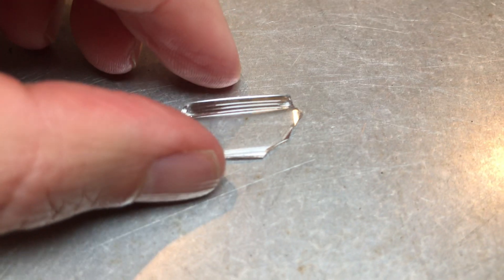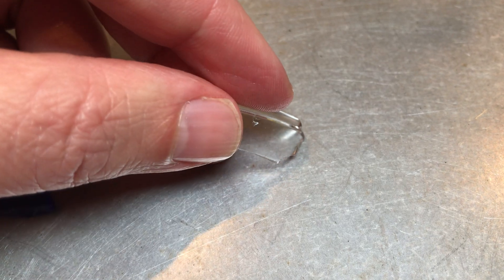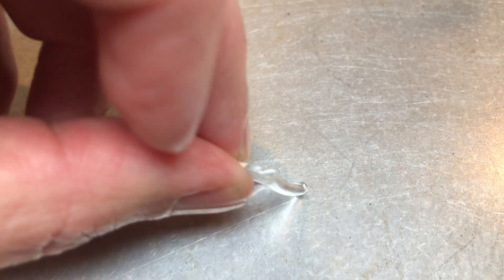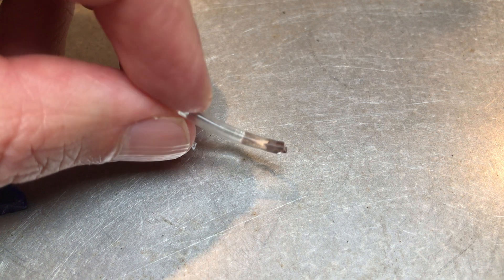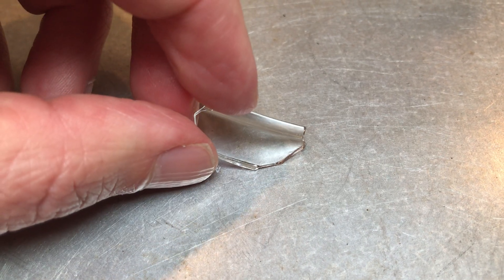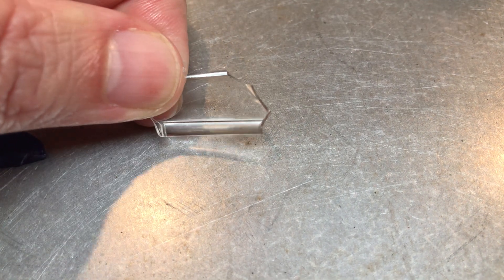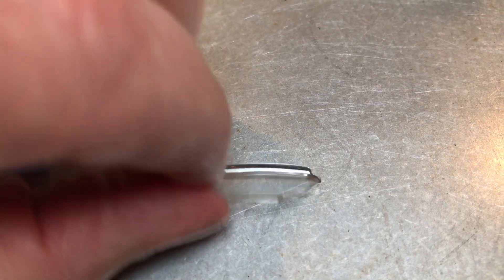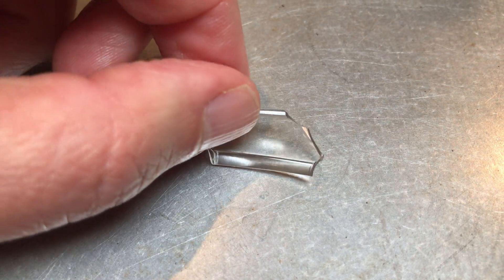Now for our second piece of glass, it's a little bit different. This one's clear — obviously transparent. I don't see any letters or anything like that on it, but what I do notice is that it has this very fine beveled edge, almost like the rim of a glass. Not really chipped — maybe a small one on this side — but mostly transparent with that beveled edge and maybe one or two chips as the fine details.